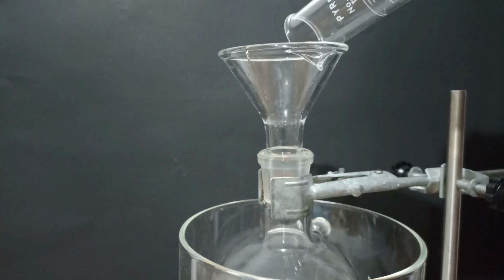I wanted to get as much p-aminophenol as possible, so I'm going to extract the p-aminophenol that remained dissolved in the filtrate. I started adding sodium bicarbonate until the pH was between 7 and 8. P-aminophenol has 2 pKa's. The first one is at 5.48.